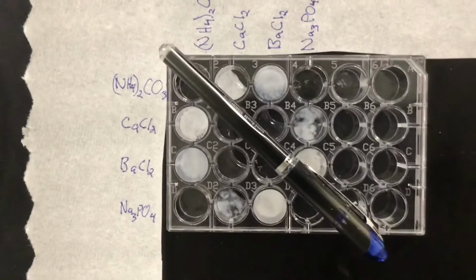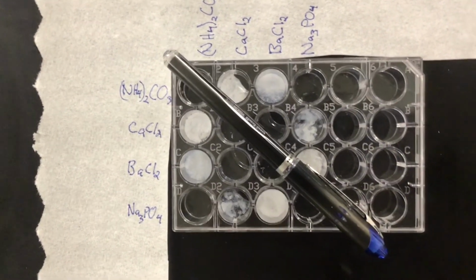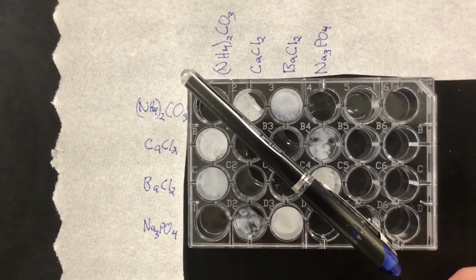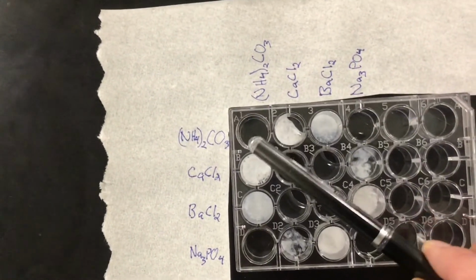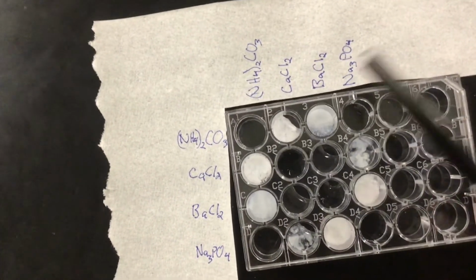So if you really want to know what's kind of going on, just look at half of it. And you'll be able to, from there, see what is mixed with what, because there should be nothing happening when you're mixing the same thing with the same thing. Nothing should happen, and these are all mirror images of them.